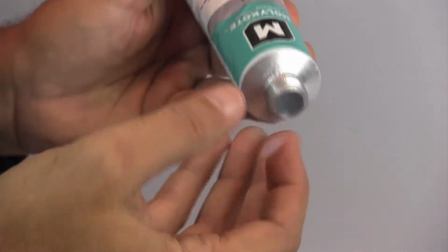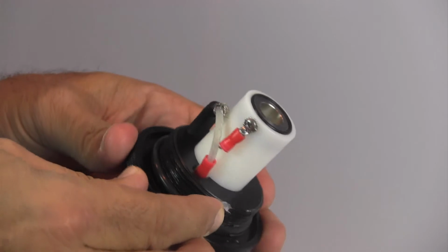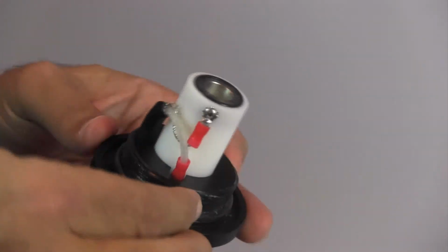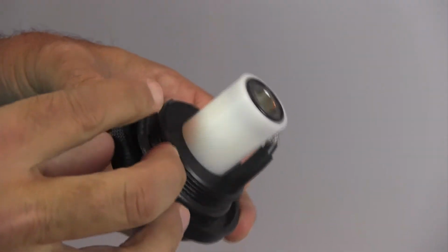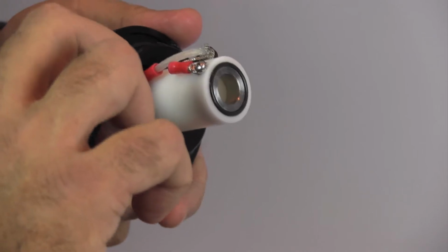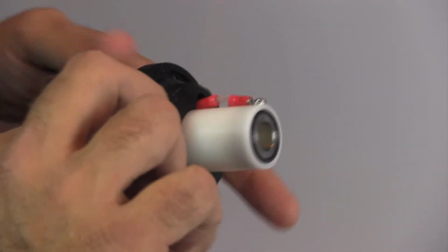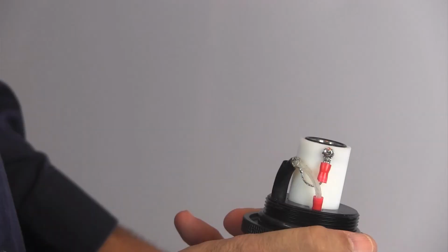Apply silicone lubricant and sealant to the threaded portion of the sensor block ring as well as to the large O-ring at the bottom. This will complement the sensor seal as well as act as a lubricant for later openings. Note the wire orientation. The thicker insulated wire should be at the bottom and the bare wire connected to the electrode at the top.